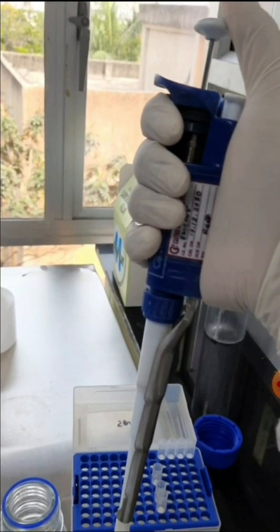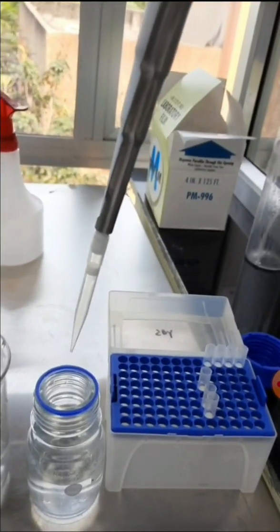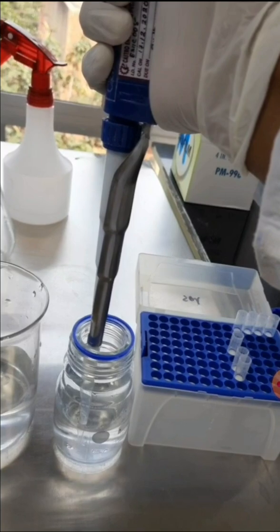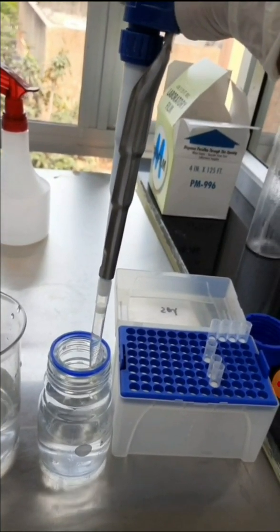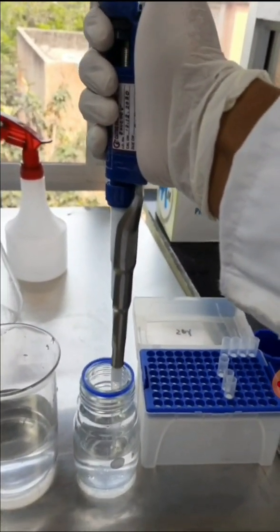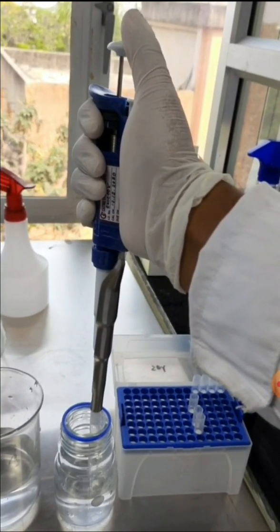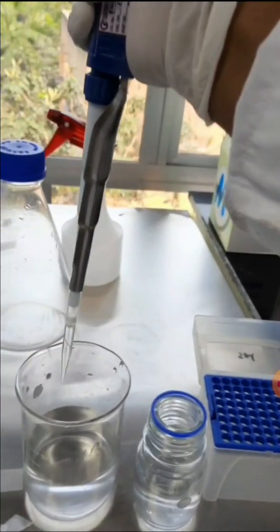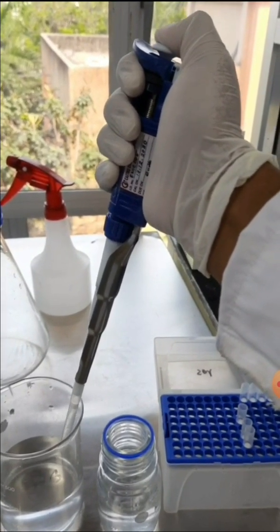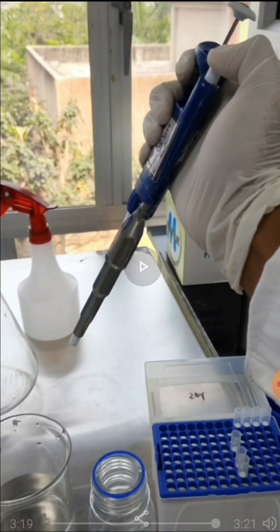When releasing into a different container, press to the first stop and then press fully to the second stop so any remaining sample in the tip is also released. We uptake by pressing to the first stop, place into the sample, draw up 1 ml — here we can see 1 ml of sample is uptaken — then press to first stop and then second stop to fully dispense. Then eject the pipette tip.